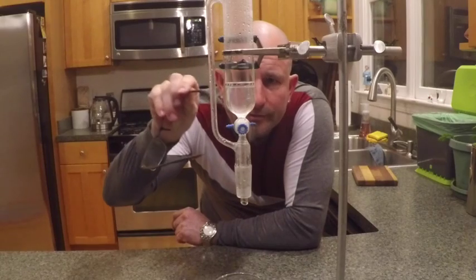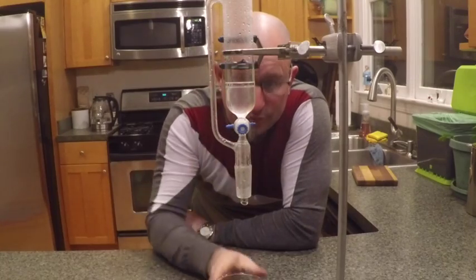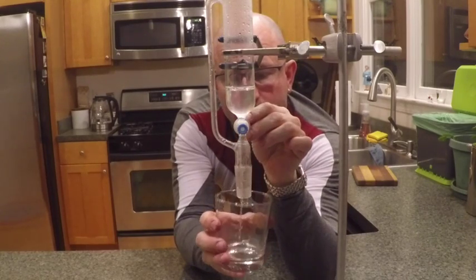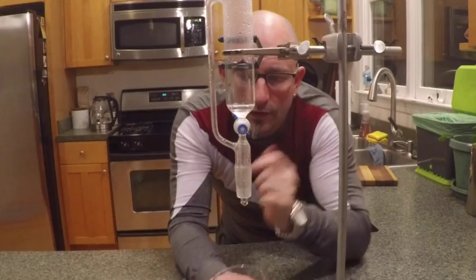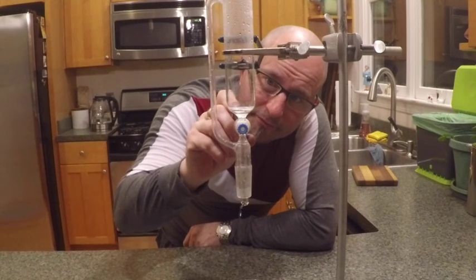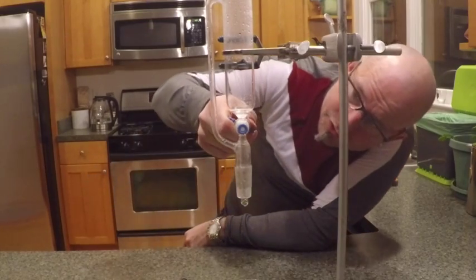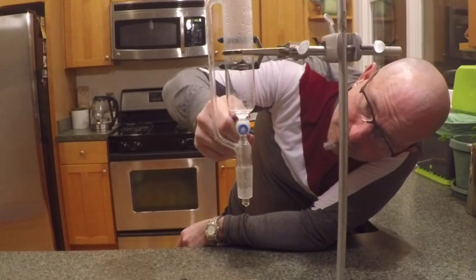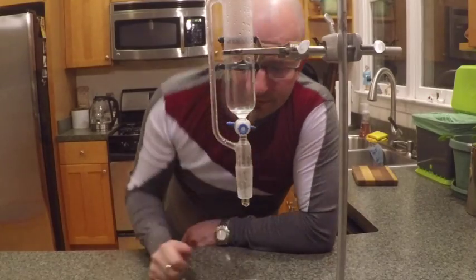Here's the orange oil layer, and this layer right here is the hydrosol. The first thing we should do is take off that layer of hydrosol by opening this out. It smells great, I have to say. You want to trap the interface of the tube into the valve if you can. There we go — and this here is the oil.